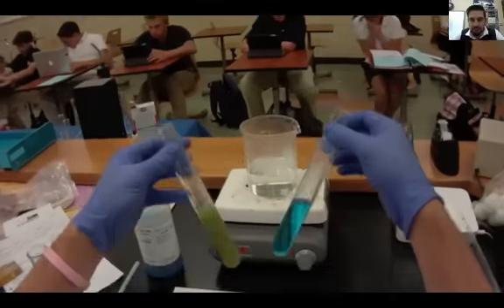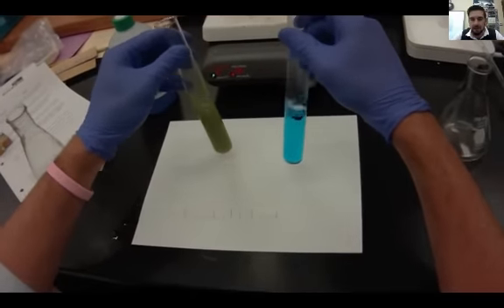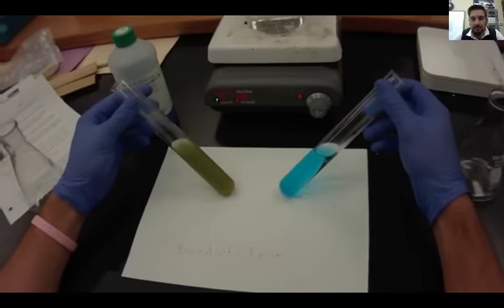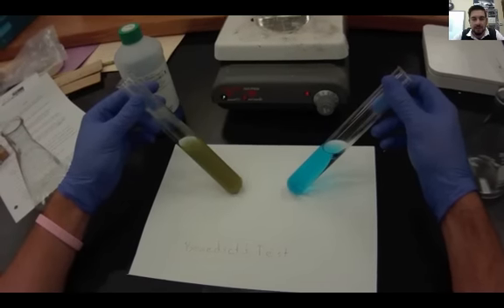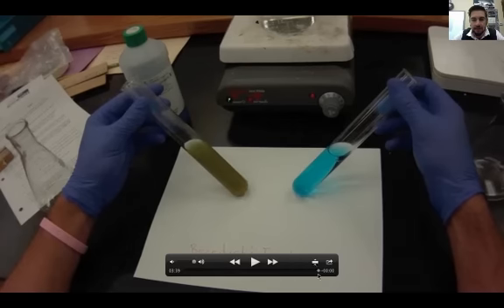You'll notice a dramatic change on the one on the left. That is a positive result. The one on the left has monosaccharides in it. These are all just organic molecules we were testing today to determine what kinds of things were in each sample. The one on the left definitely has monosaccharides in it.